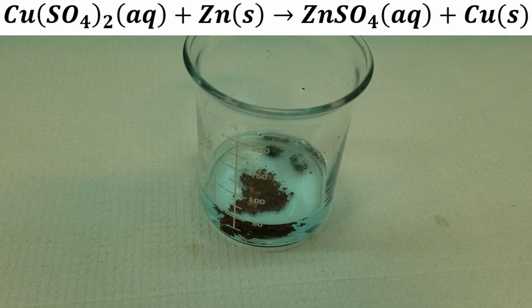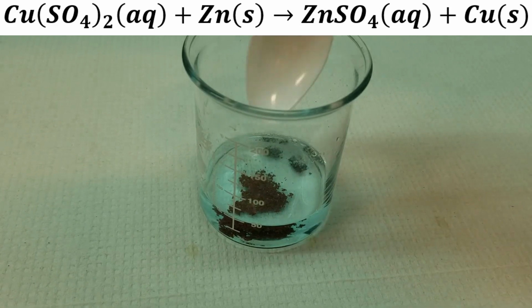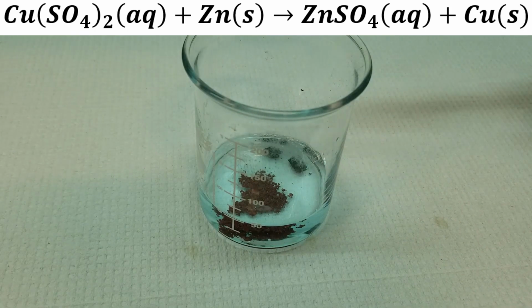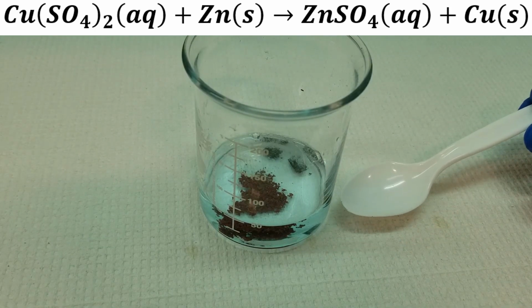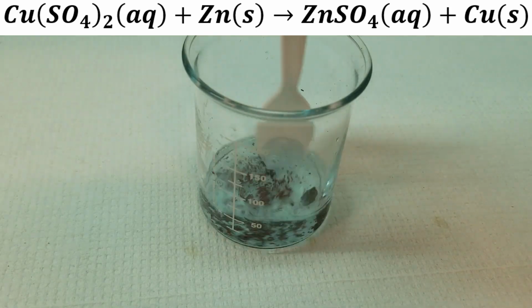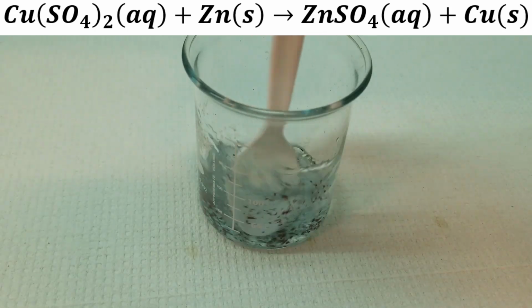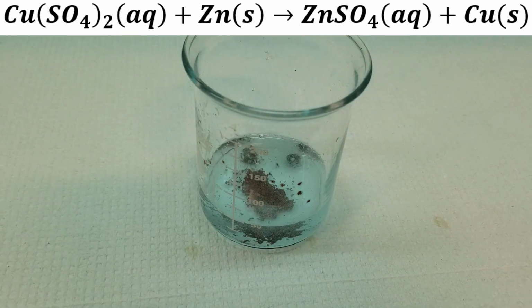Okay, so the reaction's been going a while. You're seeing that some of the blue color is fading. How do we know when we've gotten all of the copper back? That brown in the middle, that reddish brown stuff, is our copper metal. Well, when all of the blue color is gone, that means we've recovered all of our copper metal. So we'll just keep stirring and stirring, and after a few minutes it should be colorless, and that would indicate that we've recovered all of our copper metal.